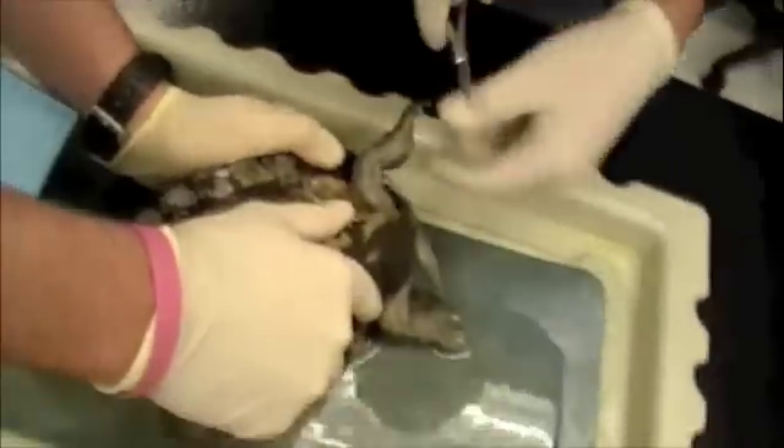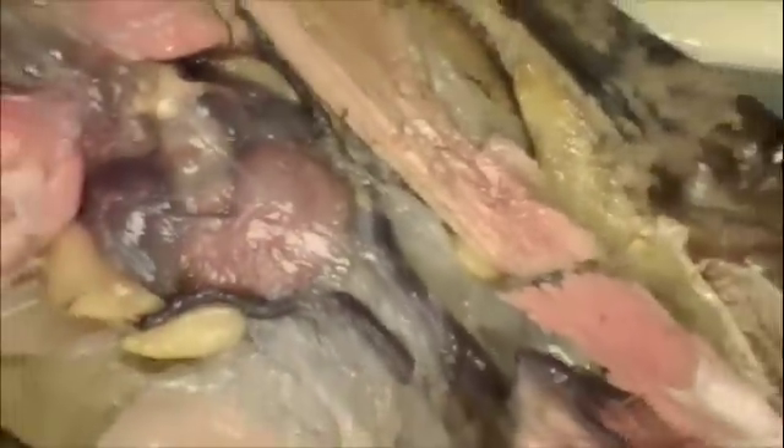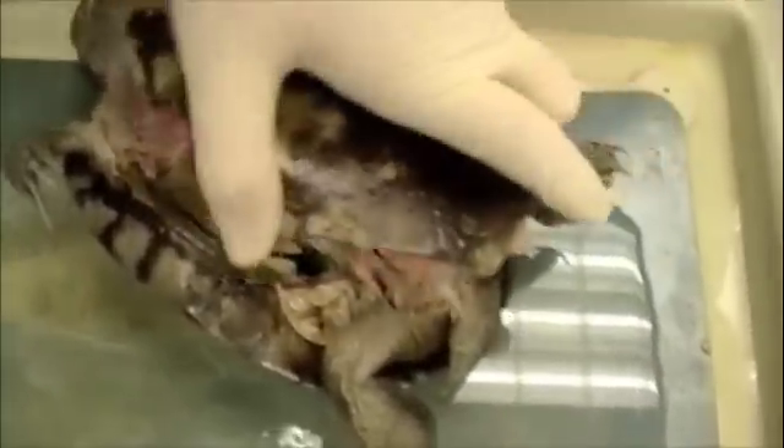Oh, I think I see some organ being torn off. Oh no, it's all right. Oh God. These scissors aren't the best. Nice, guys. Yeah, that's definitely the problem in this situation. Testes, maybe? I don't know. Fat. Fat bodies — those are up towards the top.